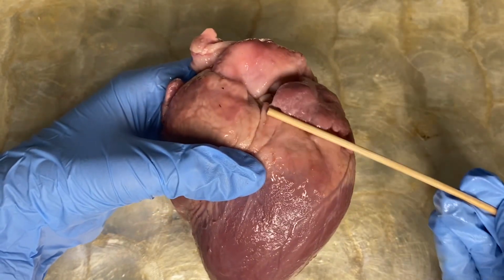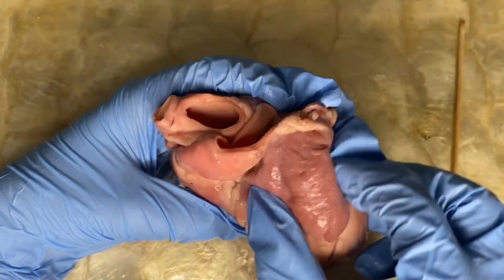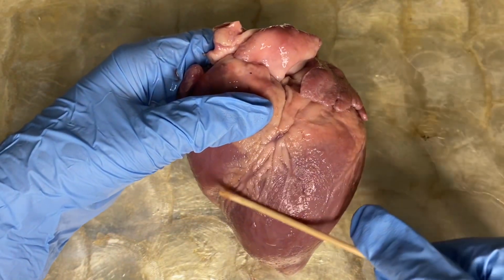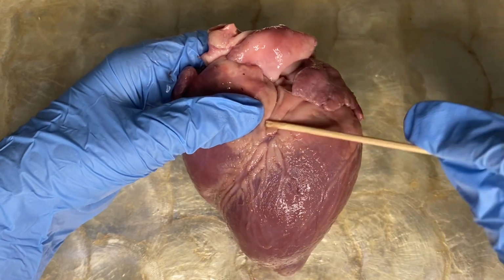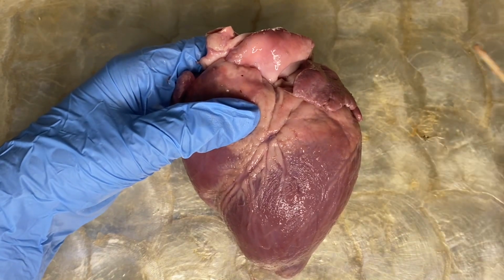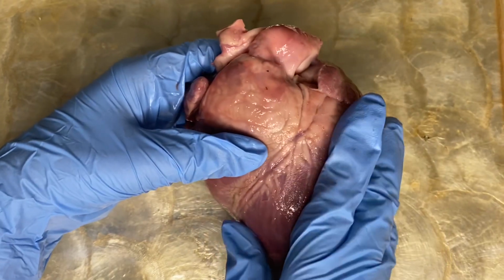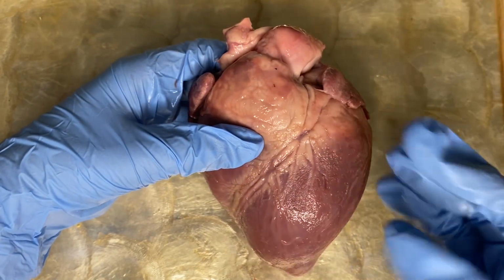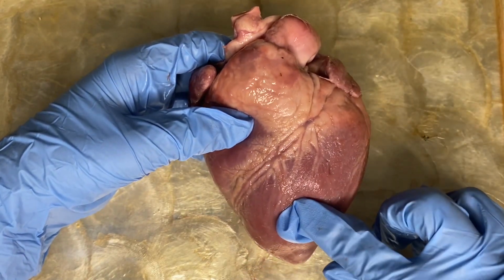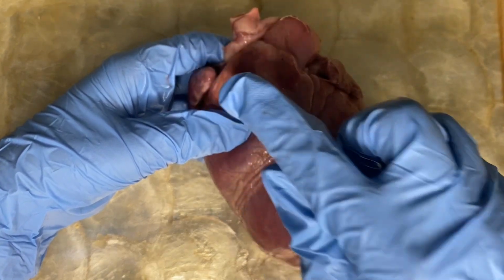Okay, if this is the back side of the heart, this is our left atrium. Next, how about the ventricle? This big portion of the muscle here is the left ventricle, located at the lower chamber to your right. Now, compared to the right ventricle, this is bigger because this chamber will supply the oxygenated blood throughout the body, so it needs to be more muscular than the right ventricle. Again, those are the four chambers of the heart.